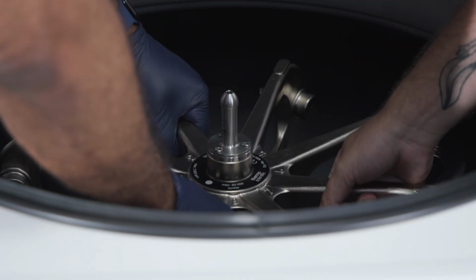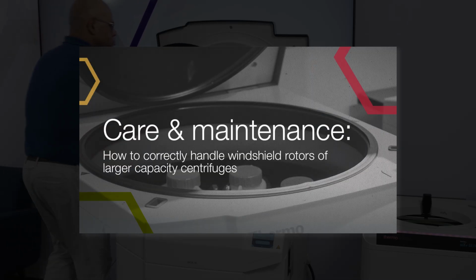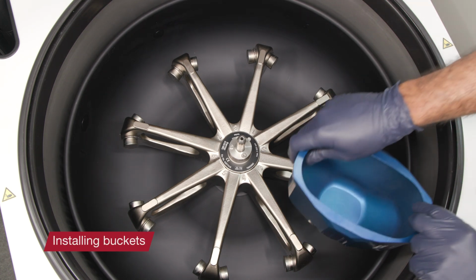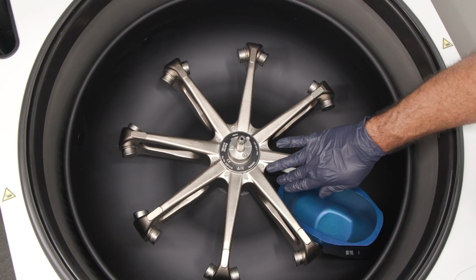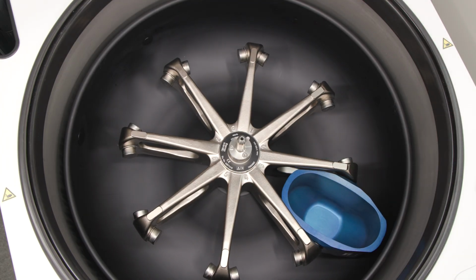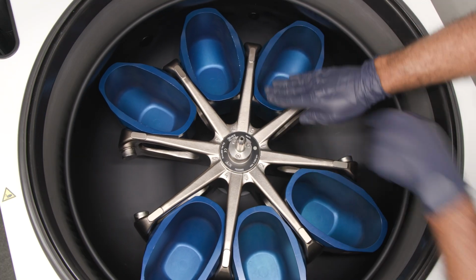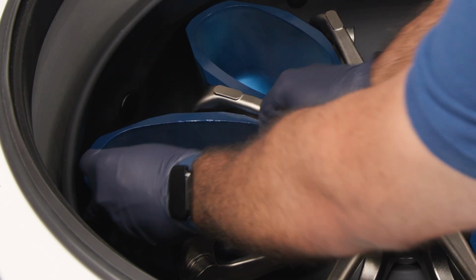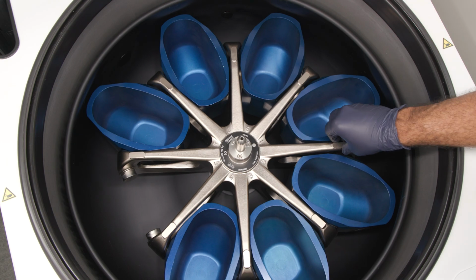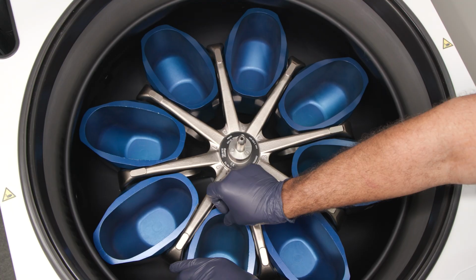The next step is to install the rotor and windshield. Please refer to our video about handling the windshield and rotors of large capacity centrifuges. After installing the windshield and rotor properly, it's time to install an empty bucket in each position. Install buckets of the same weight class as indicated on the bucket itself, and position buckets opposite each other to help ensure even weight distribution. Make sure each bucket swings out correctly. They must swing freely on their rotor trunnion bolts. Always use a full complement of buckets, even if some buckets remain empty, before operating the rotor.